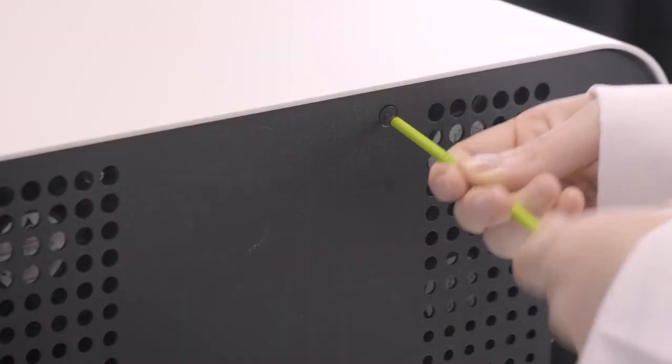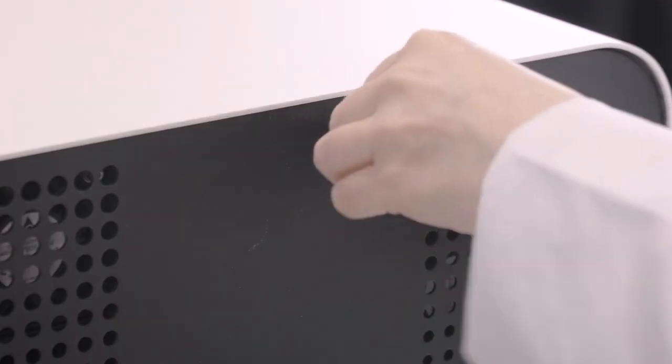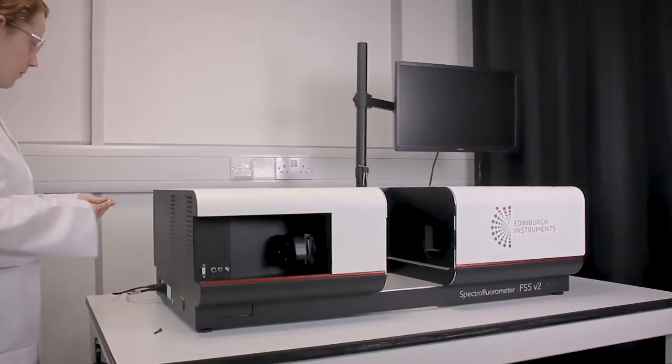Remove the black screws on either end of the instrument as shown using an Allen key. There are 2 screws on one side and 3 screws on the other.